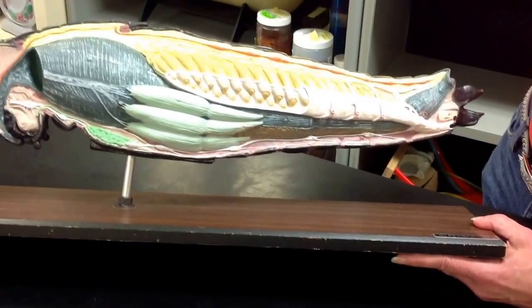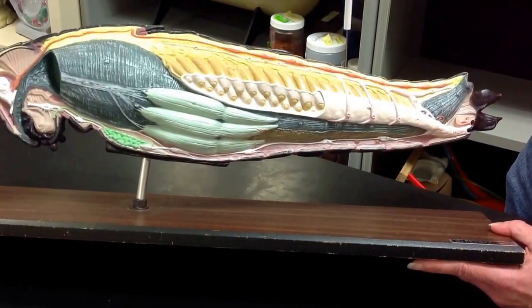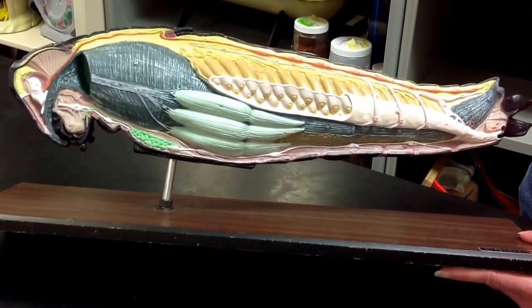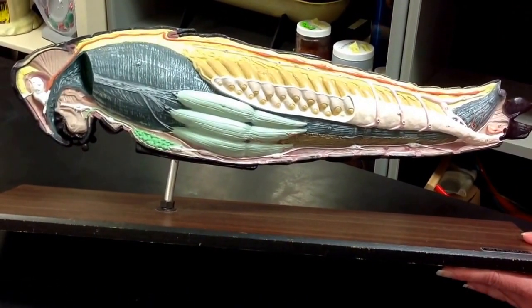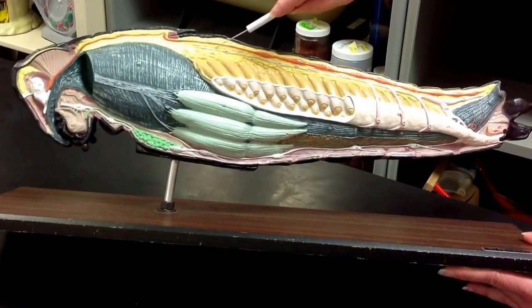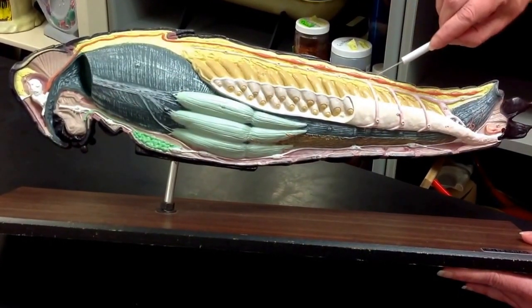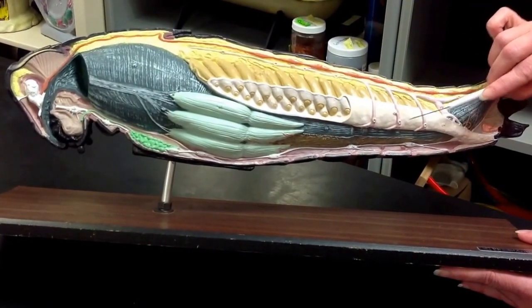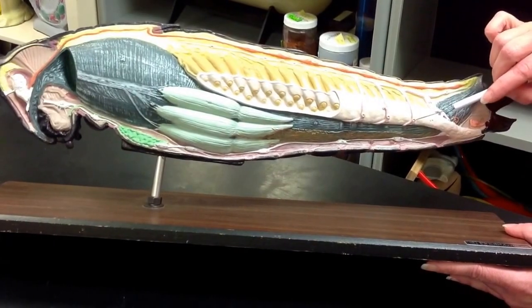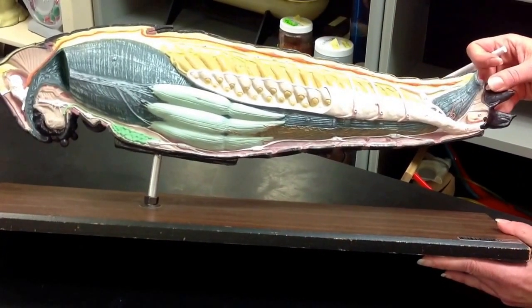We have nine hearts, which are enlarged sections of the dorsal blood vessel that you see going to the anterior section. The respiratory system is formed by this dorsal tracheal trunk that leads into tracheal branches. This is an air sac here. Each of the tracheal branches ends in a spiracle that comes through the exoskeleton.